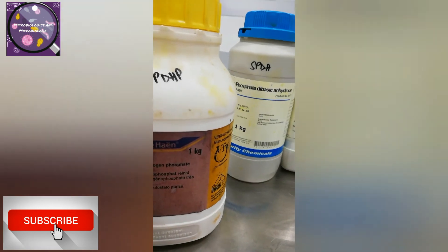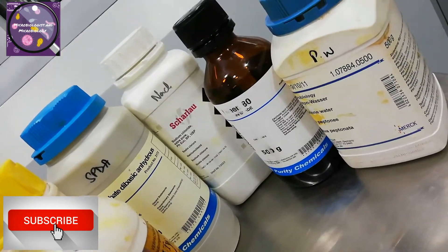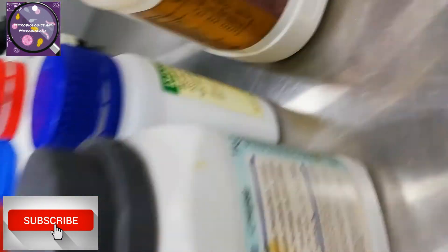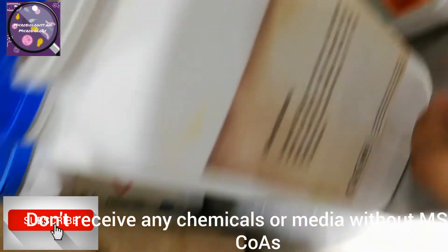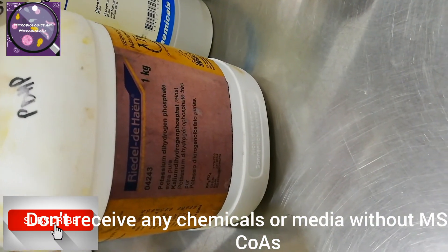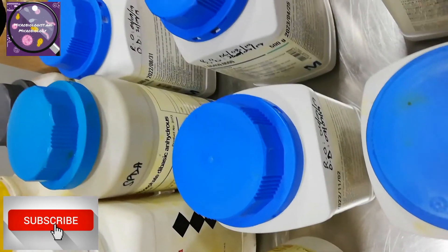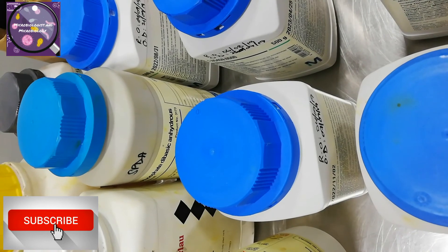These are my usual media used in my lab. Of course I have certificates and MSDS for each chemical and media available in my microbiology lab. If the brand, company, or supplier does not provide the COA or MSDS, do not receive the chemical or media.